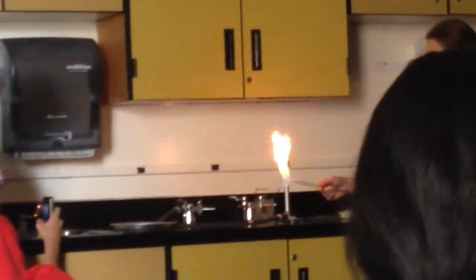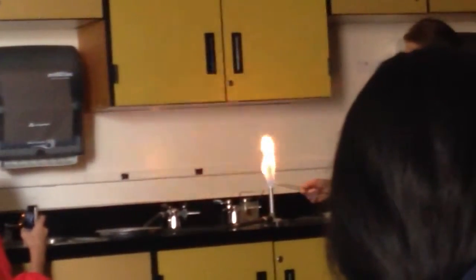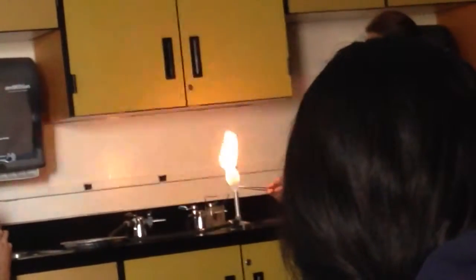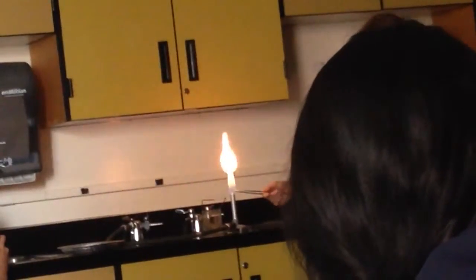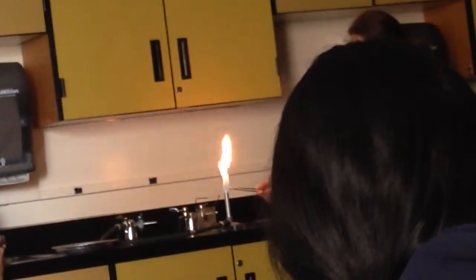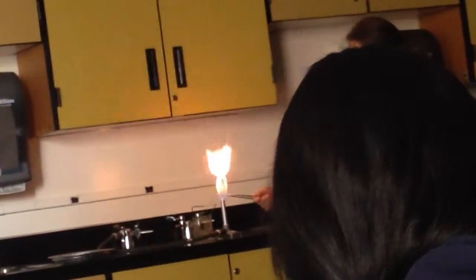You guys can help me look — it's going to start to spark a little bit. When it starts to spark is when I'm going to tell you to push play. Push play — starting to spark. What are you holding? That's a piece of magnesium. If you touch the tweezers right now, you'd get probably a nice little second-degree burn, it's so hot. It's taking a lot of heat. Enjoy it when it happens, because we probably only have time to see it two, maybe three times.